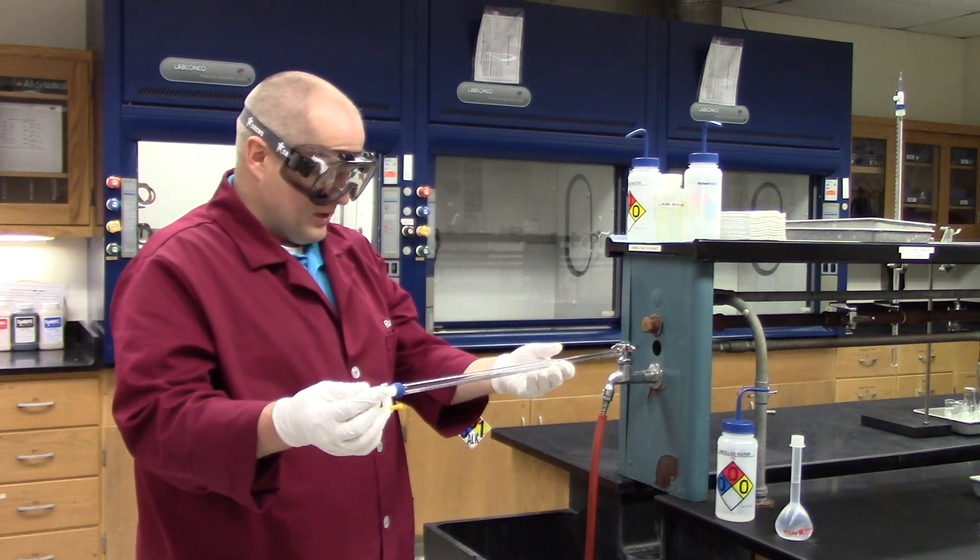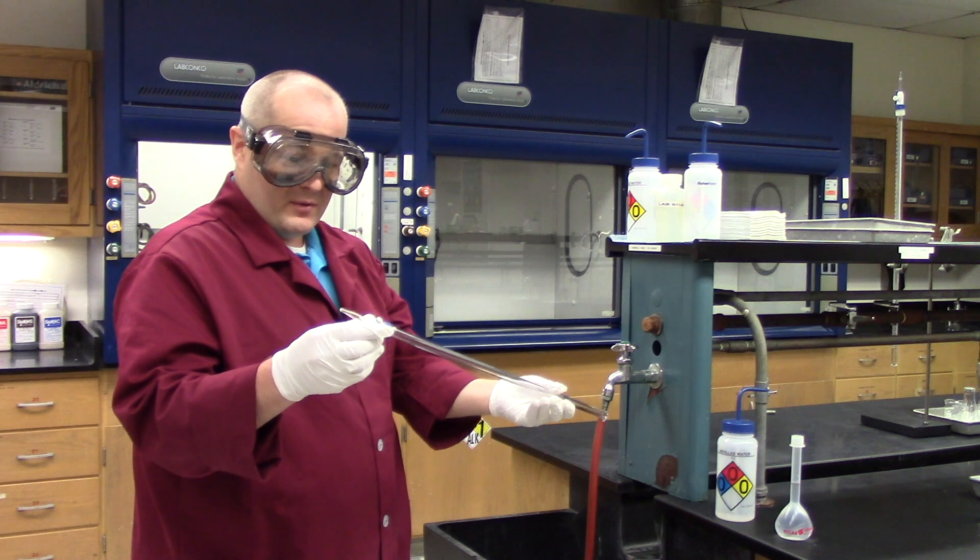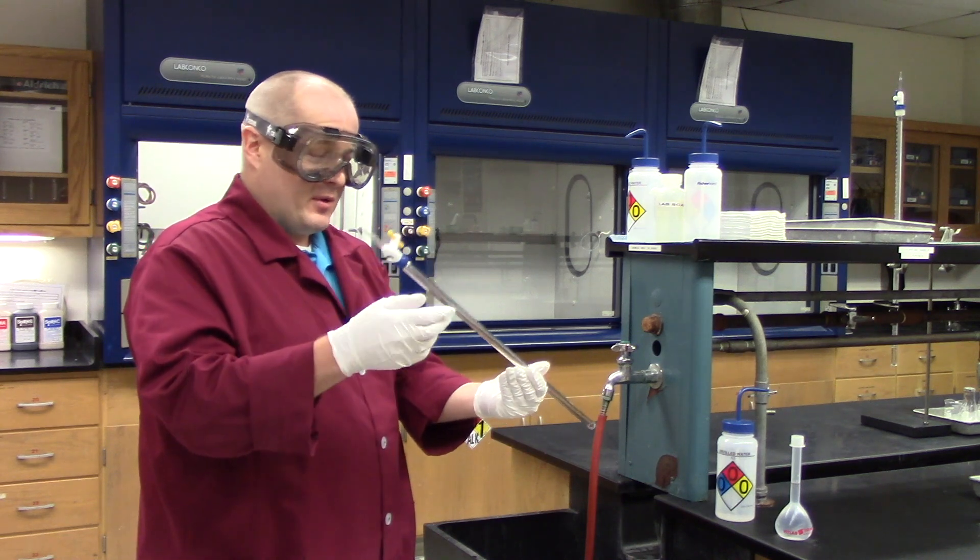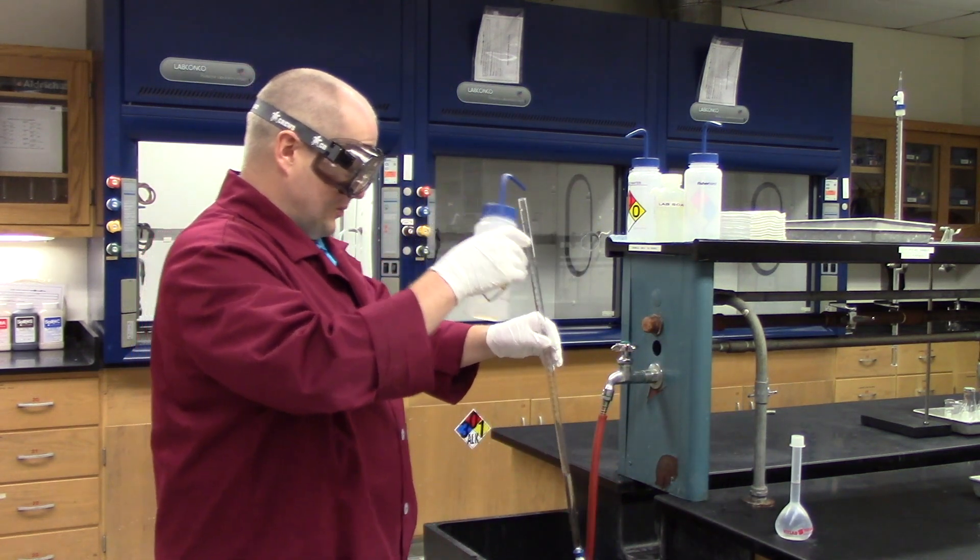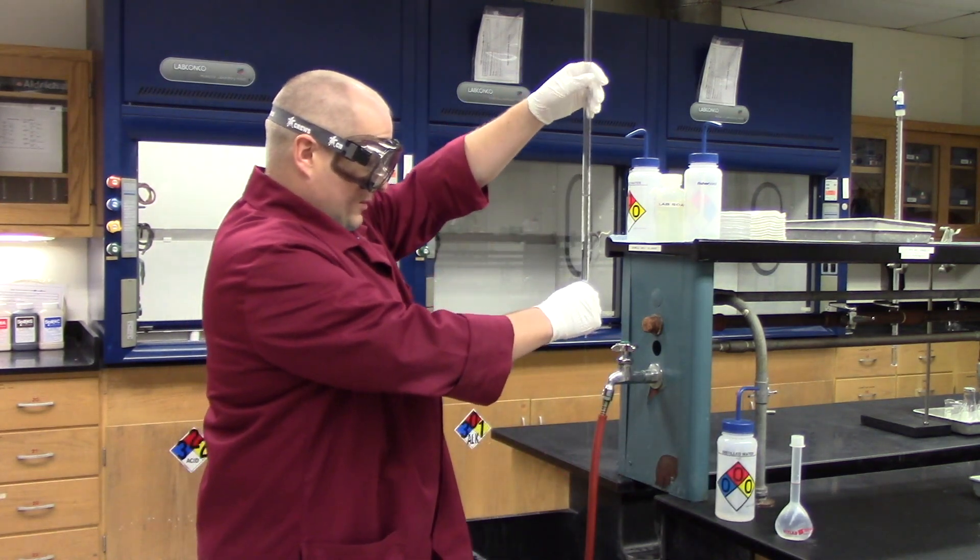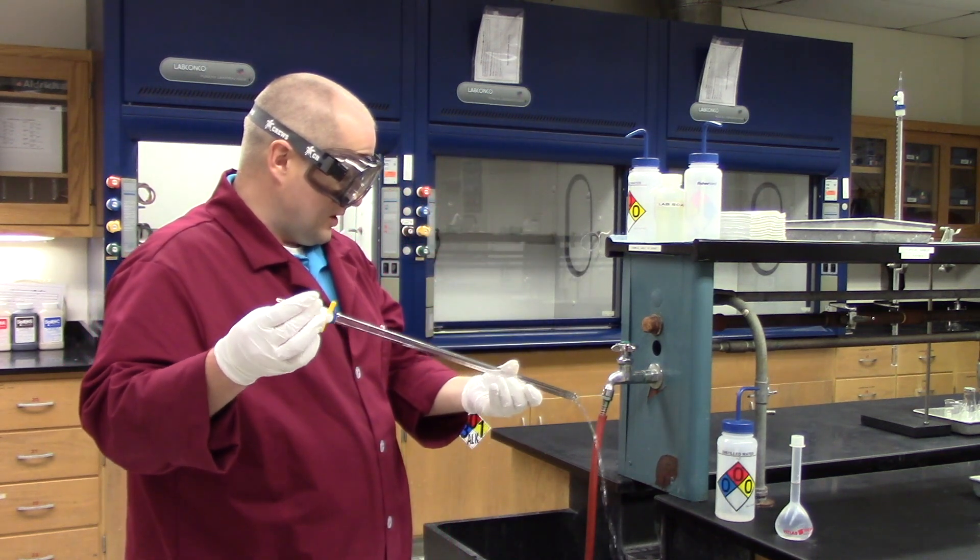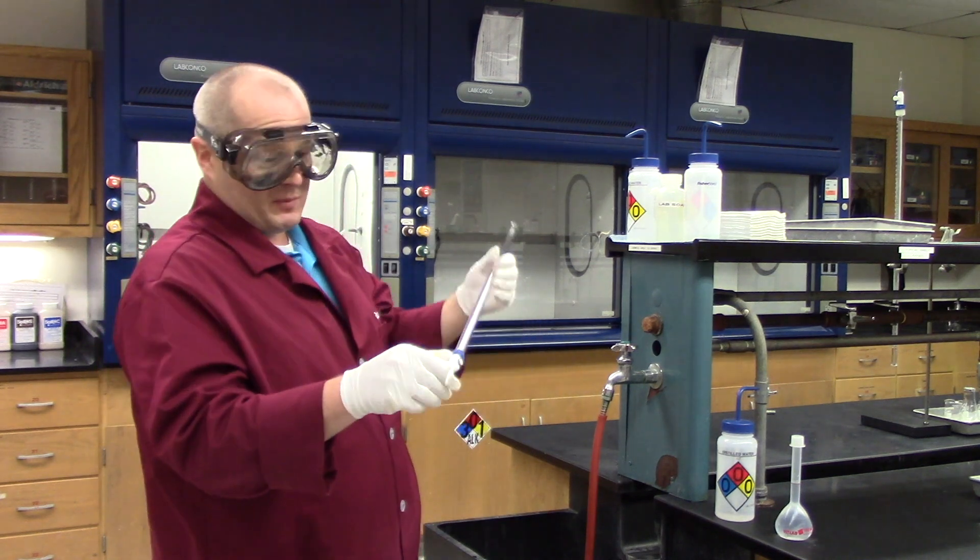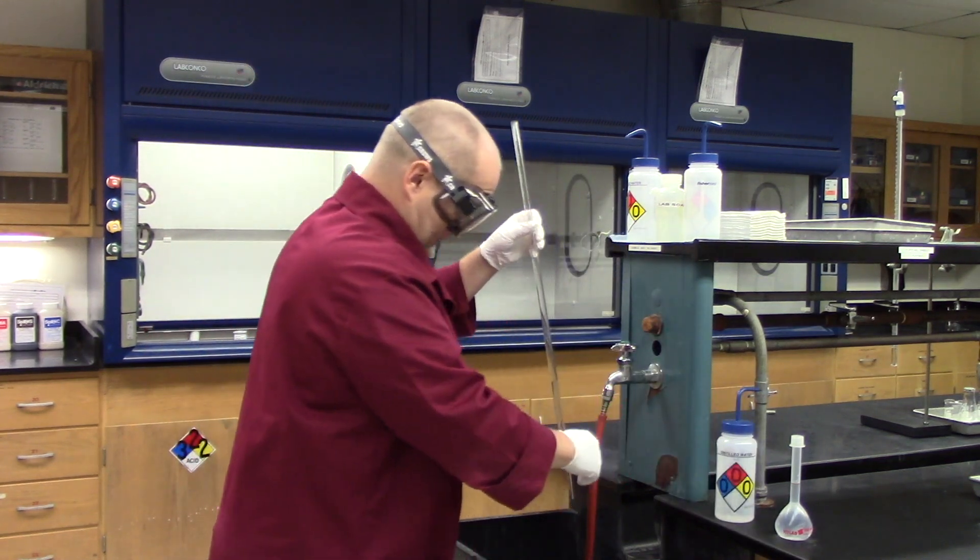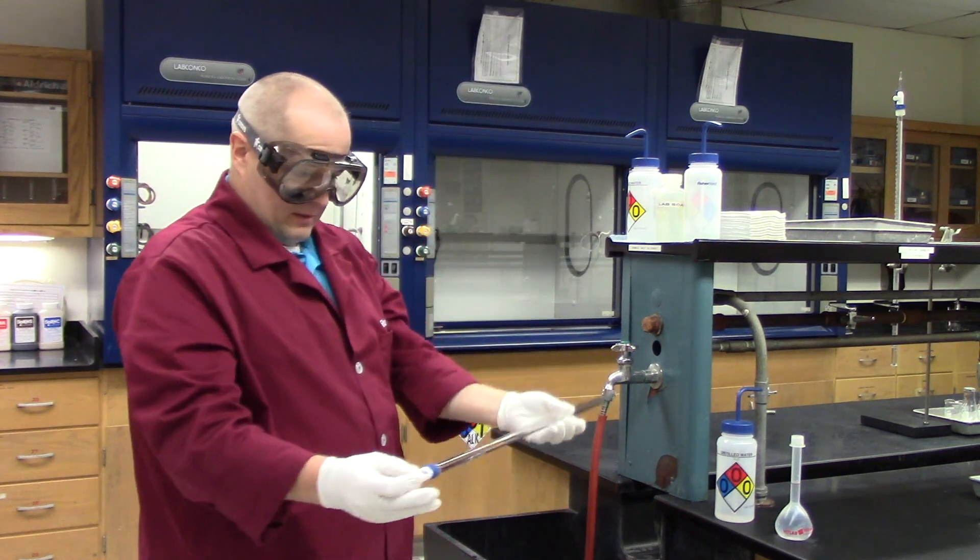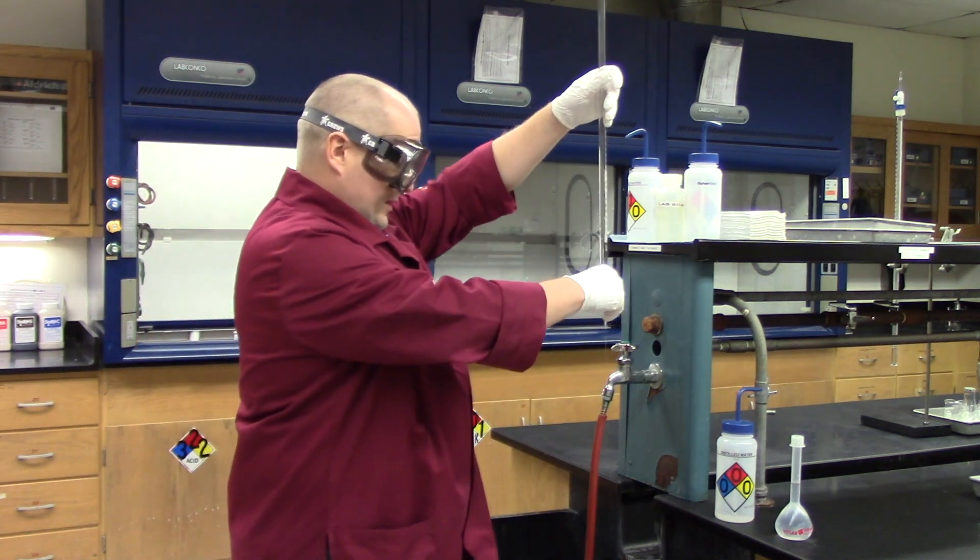Turn the burette down to a horizontal position like this, and then let the water flow out while turning the burette in your hands. What we are trying to do is allow the water to coat the inside of the burette and rinse out any impurities or things that may be there. Do that two or three times just to make sure we get the burette nice and clean. We want to ensure there is no debris in the stopcock area, and we want to ensure that there is nothing that is going to mess up our results or give us some errors that we could possibly avoid. Let's do one final rinse with water just to make sure everything is good. Let some run out the bottom, run out the top of the burette, just keep rotating it so the water coats everything. Open the stopcock, let the water drain out.